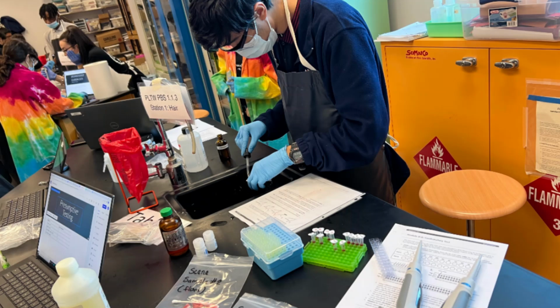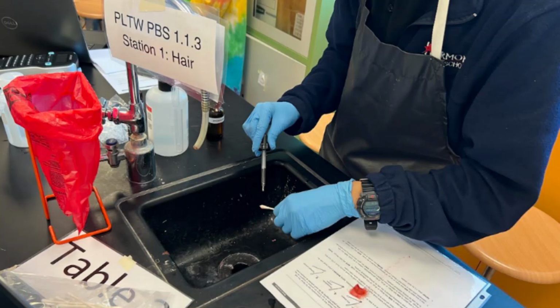When testing, each experiment took an average of 8 to 10 drops per test. By testing the positive control, we were able to determine what a positive blood result is supposed to look like when reacting with the chemicals in the materials list. When testing the negative control, we were able to visually understand what happens if the blood sample is not actual blood. The cotton swab's red color started to fade after applying the chemicals representing fake blood.